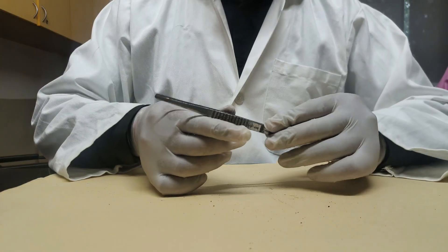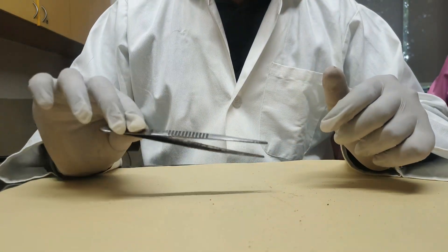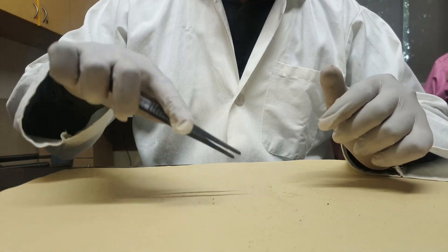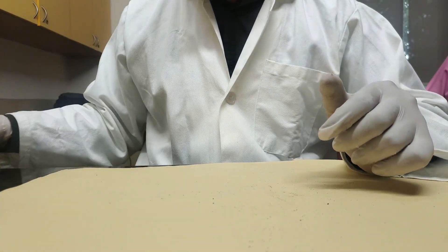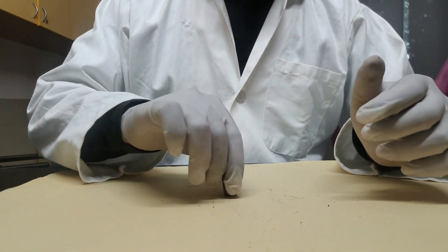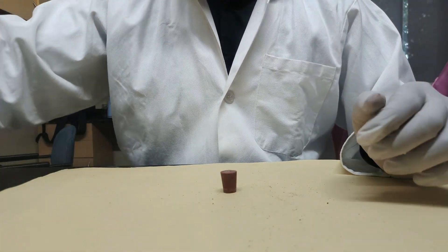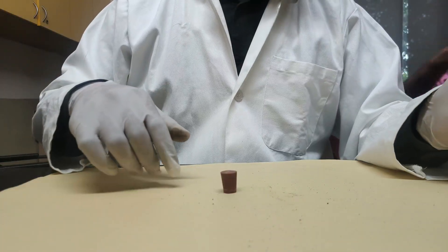Next item is forceps. They are made of metal and work like tweezers. They are used to hold any particular object inside an apparatus or in a chemical. Next is the cork. It is made of rubber and comes in different sizes.